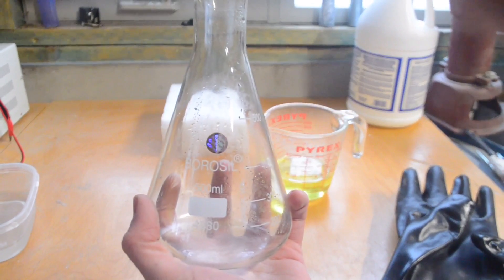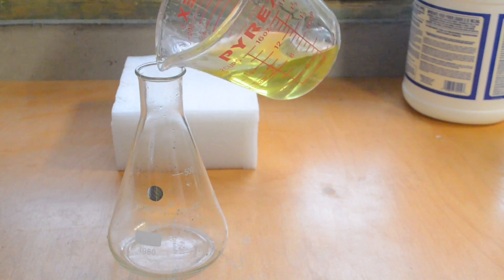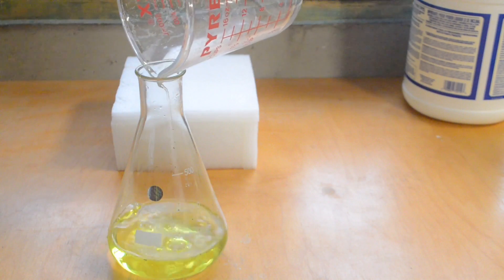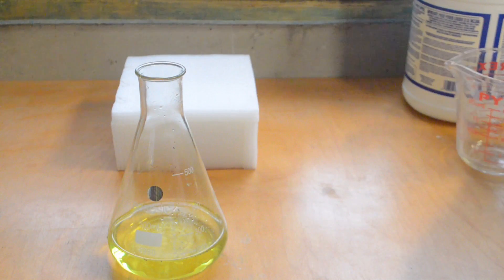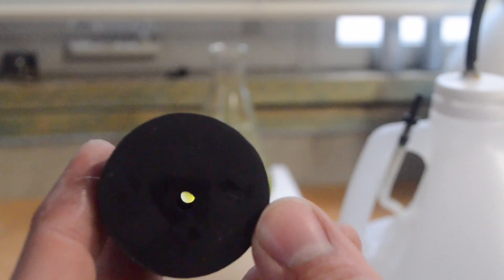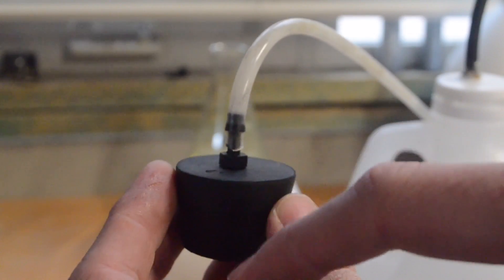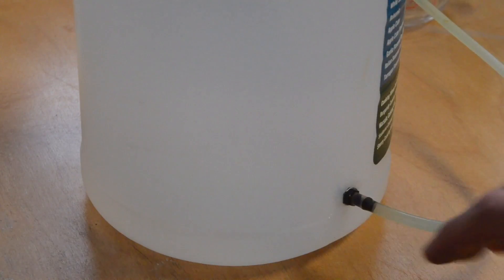Now I'm going to take this 500 milliliter flask and carefully transfer the muriatic acid into it — that's about 200 milliliters of muriatic acid. I'm going to now take the rubber stopper that goes to the flask. As you can see on the top here, we have this hole that goes straight through, and I found this tubing connector that fits right in. This should create a pretty good seal going from the flask into the tube, and I have the other end of the tube attached to this bubbler I made out of an old vinegar bottle.